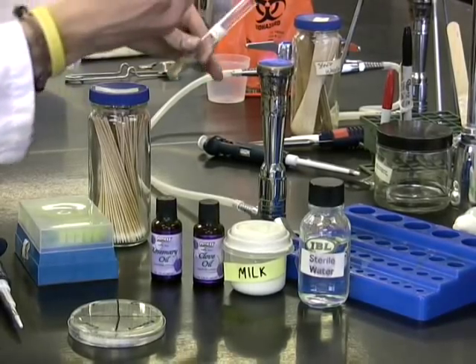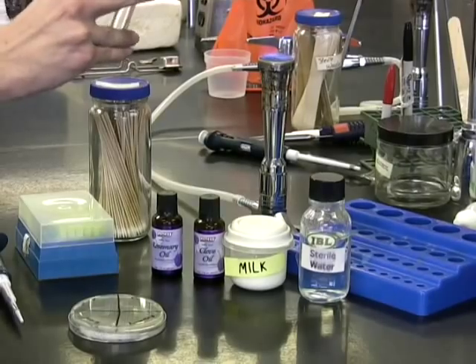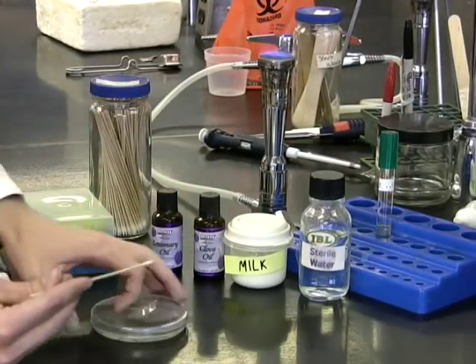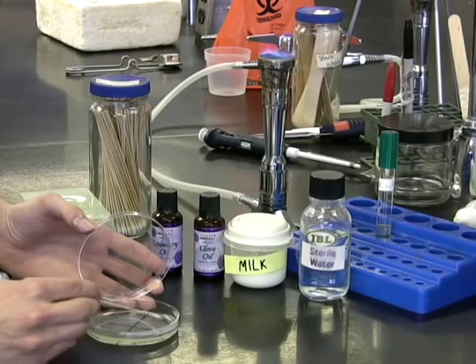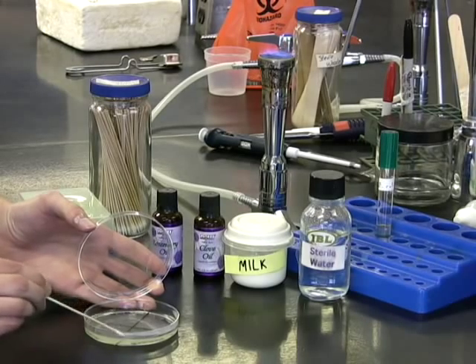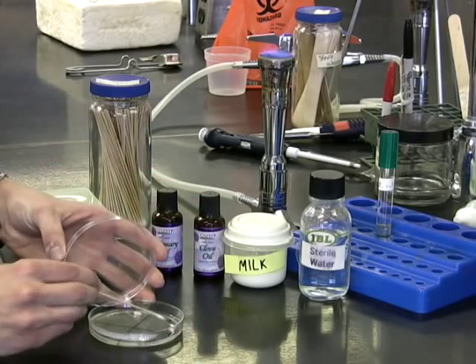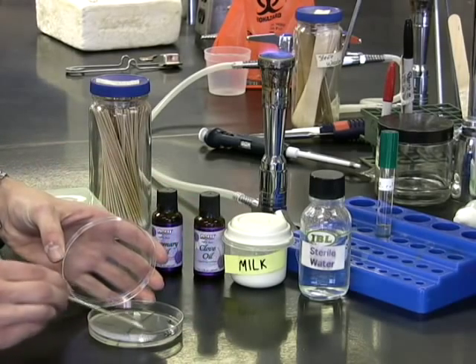To start out, you will need to inoculate the entire surface of a TSA plate with the bacteria. You want to be sure to get a nice even layer so that confluent growth is obtained after incubation. You can do this by rotating the plate one-quarter turn and doing another streak along the surface.